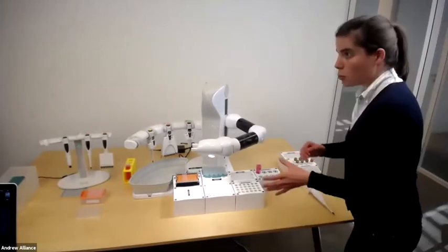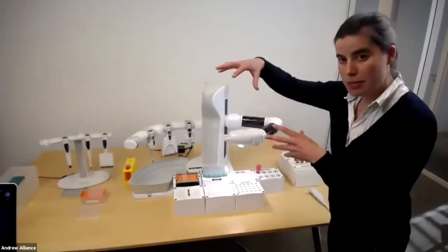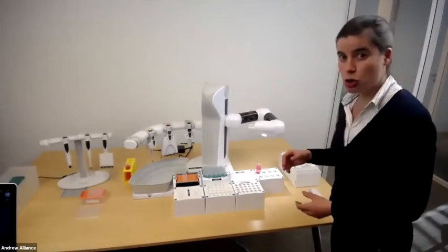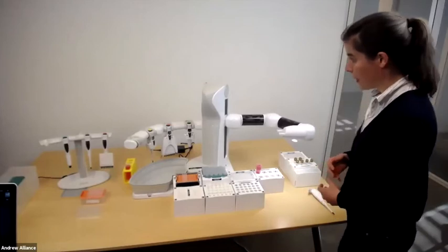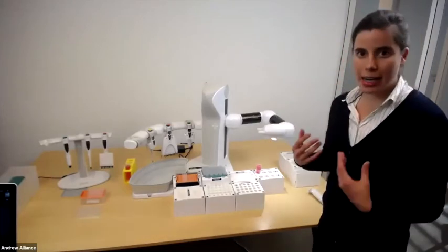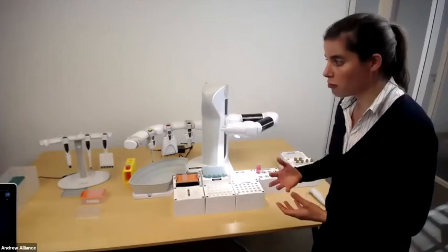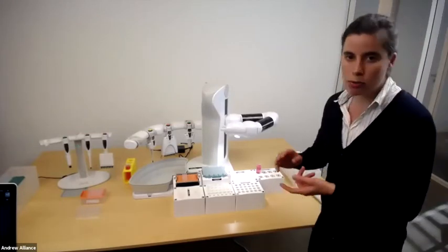So now you see we went from OneLab, and OneLab is giving the signal to Andrew Plus right here, who will start executing the protocol we just designed. Andrew Plus is really an extra companion in your lab. He's there to take over the very repetitive pipetting work, to do it without any errors.